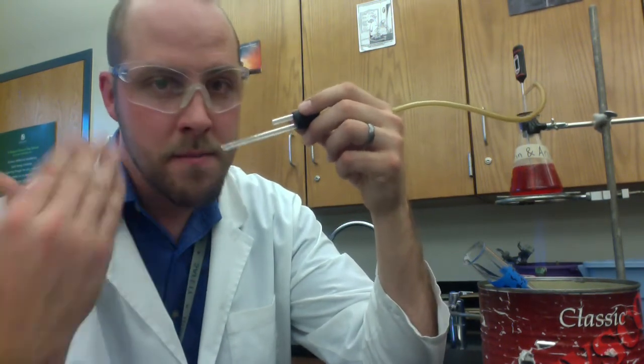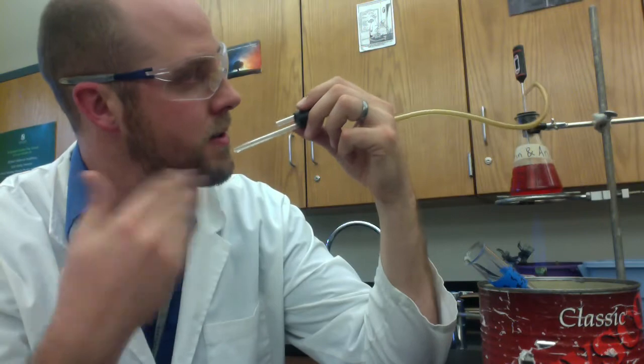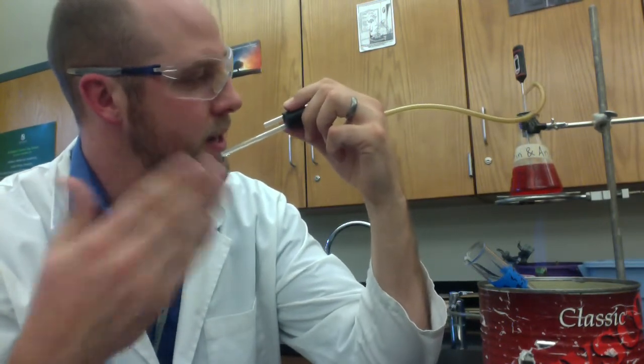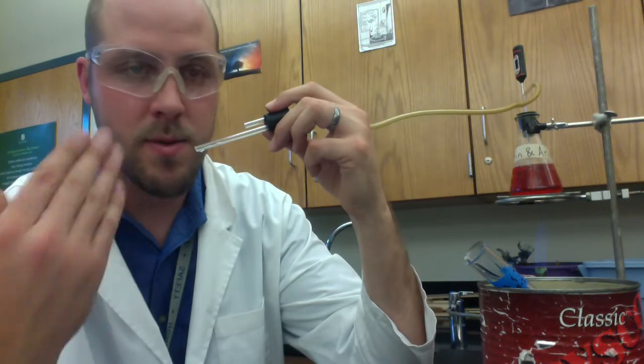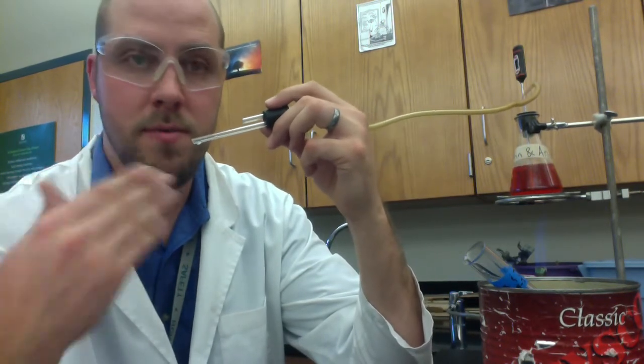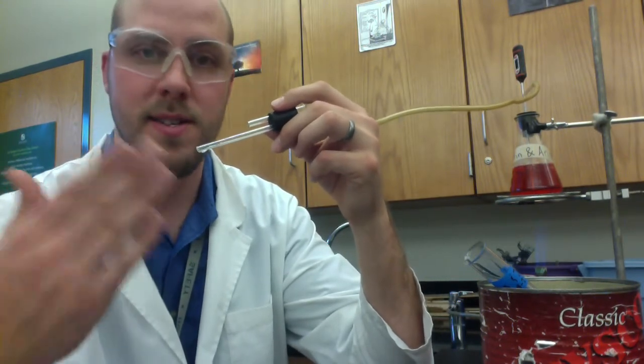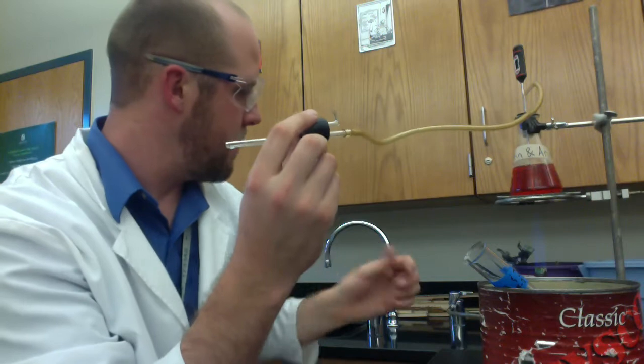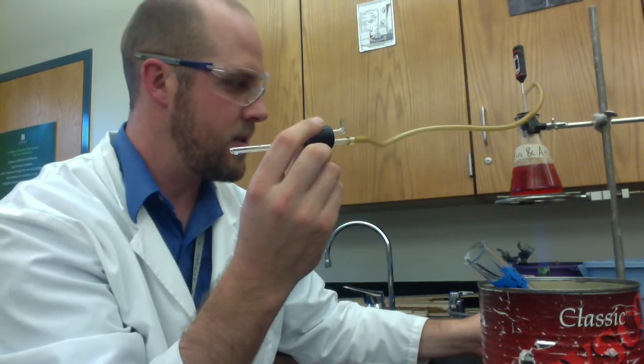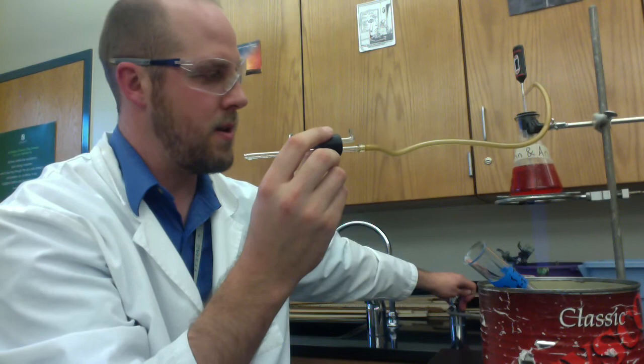We're at 40 degrees. I can tell you exactly where we are. I should start smelling that fruity ester pretty soon here. I'm actually surprised that I have not smelled it yet. It should be kind of any moment. One of the problems with this lab is since you're all doing this in the same room, you might start smelling somebody else's reaction. So hopefully you can tell the difference between somebody else's refreshy giving off lovely strawberry vapors across the room and your refreshy giving off nice smells. I'm going to turn up the oxygen a bit here. See if I can get this reaction going a little bit faster. Because it is Friday afternoon and Mr. Barkland wants to go home.